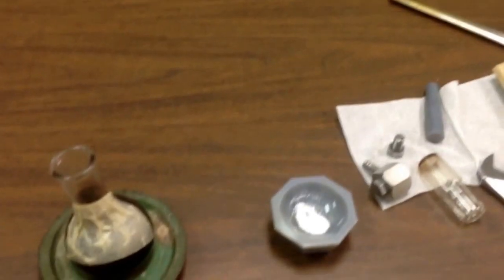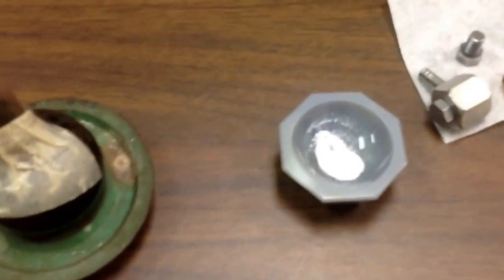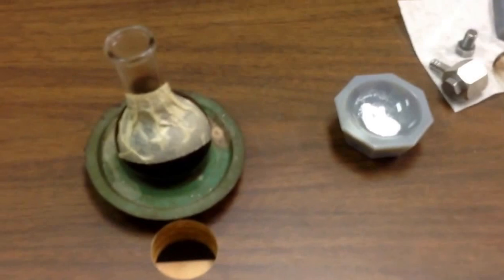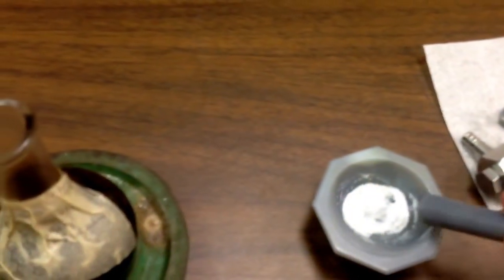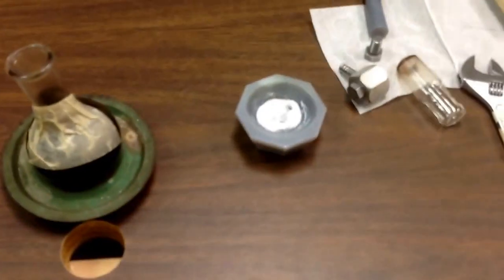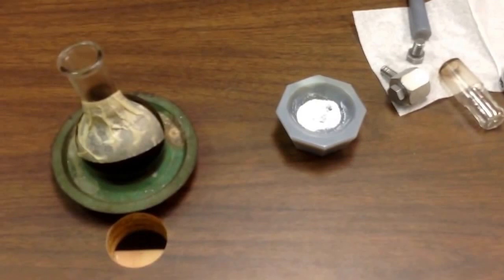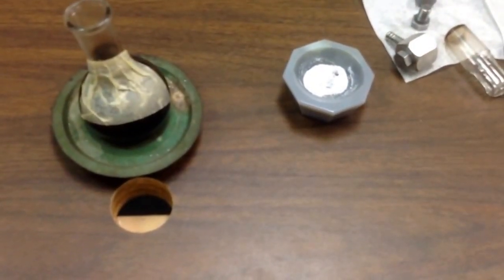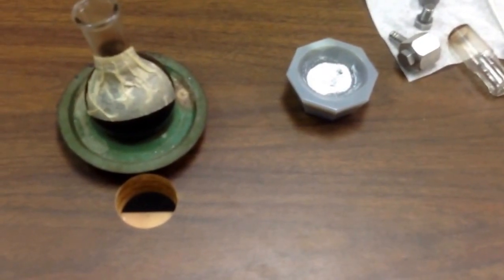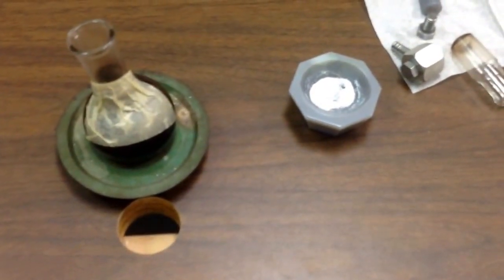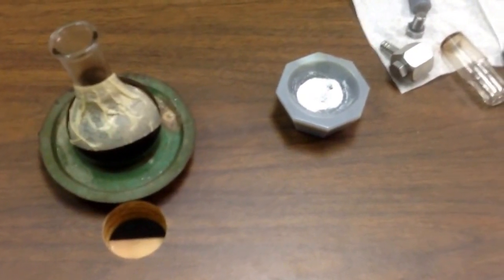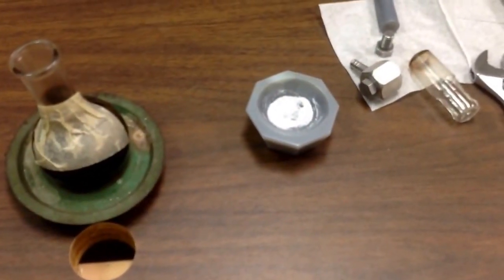I went ahead and taken some potassium bromide, this nice white crystalline solid. I used the pestle here to grind it up. I'm going to grind a lot harder for my sample. Generally, about 100 milligrams of KBr is a nice amount of sample matrix. And we're going to use just about five milligrams or less of our sample. I'm not going to weigh it out today. I'm going to put a little bit of our sample in there, grind it up until we get a nice homogeneous mixture.